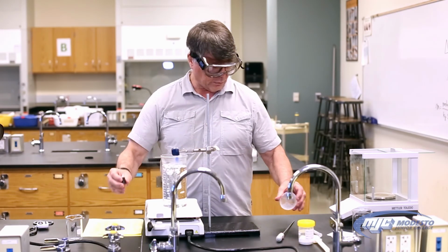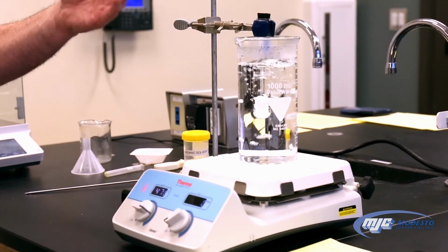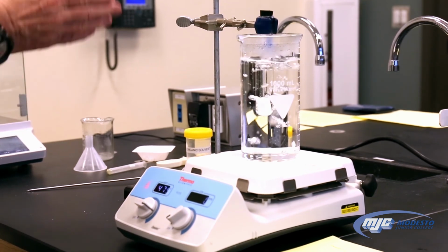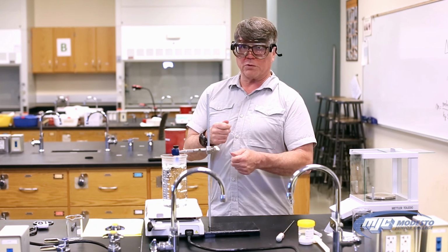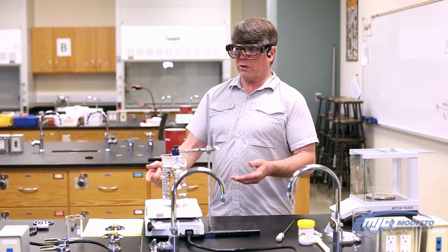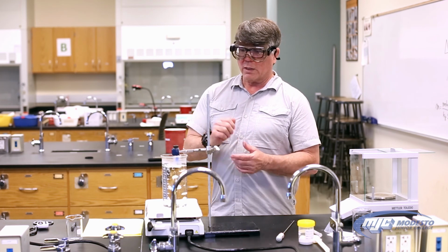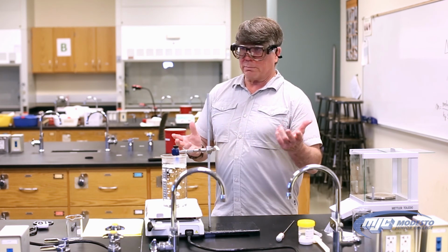And now what we do is we're going to wait for this to melt entirely. And once it does, we're just going to follow the same process we did with the pure lauric acid. Going to take it out, agitate it, record the temperature every 10 seconds until it solidifies. Temperature stays the same for a while and starts decreasing. The temperature that it stays at the longest will be the freezing point of the solution. And that's going to be the experiment. There we go.